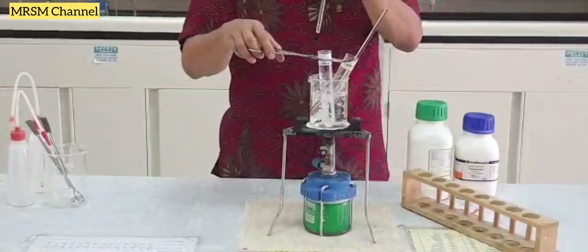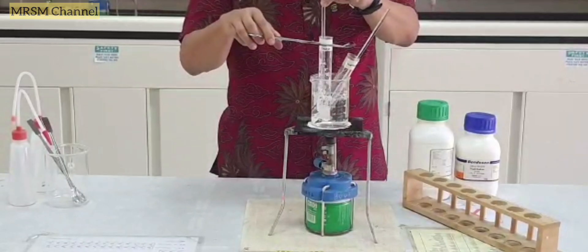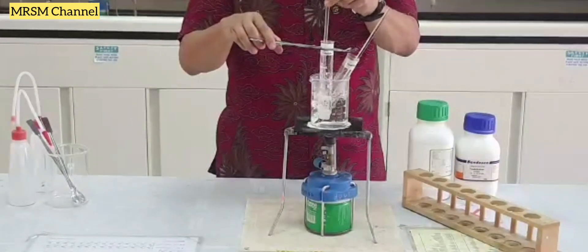All right, now let's check on our magnesium chloride. Stir it for a few seconds.